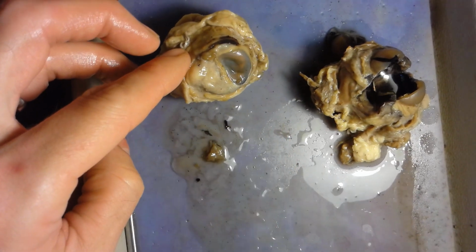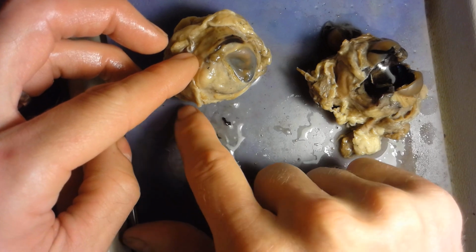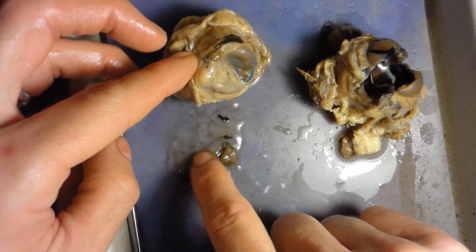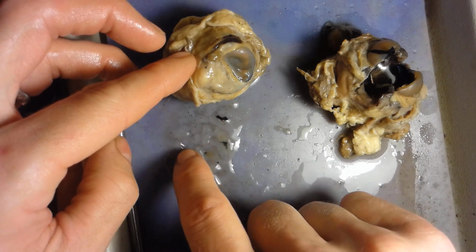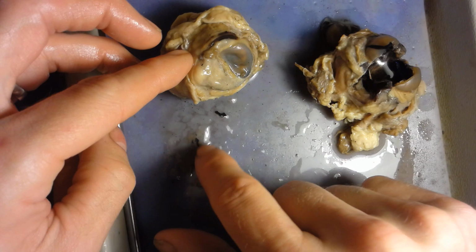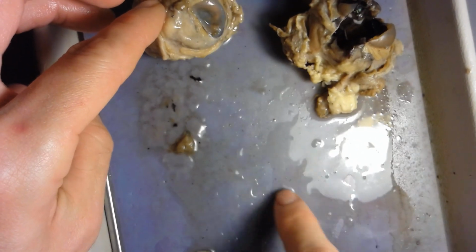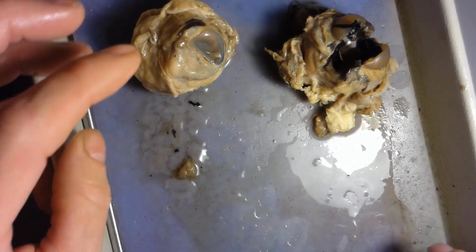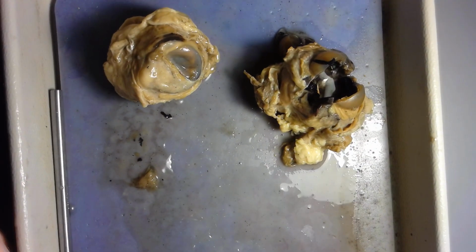You can think of it kind of like sinus fluid, like if you have a sinus infection and you blow your nose, it's a little bit thicker in texture. That would be the vitreous humor. So vitreous humor is a little bit thicker. It comes out kind of like a blob out of the eyeball. This thinner fluid is the aqueous humor, which means water-like. And you see those just in the real eye here, not in the eye model.